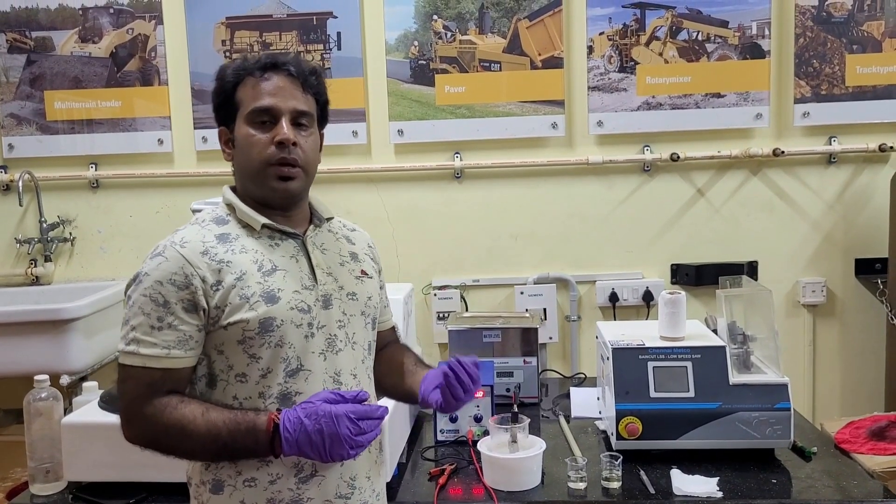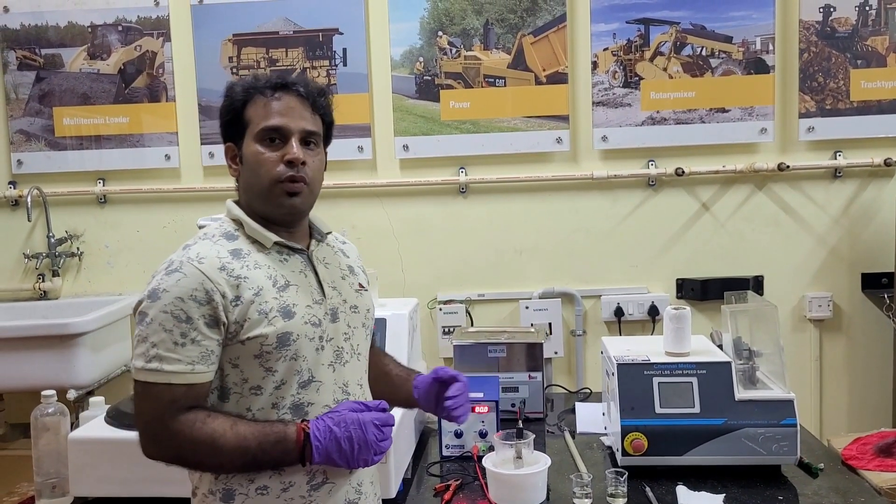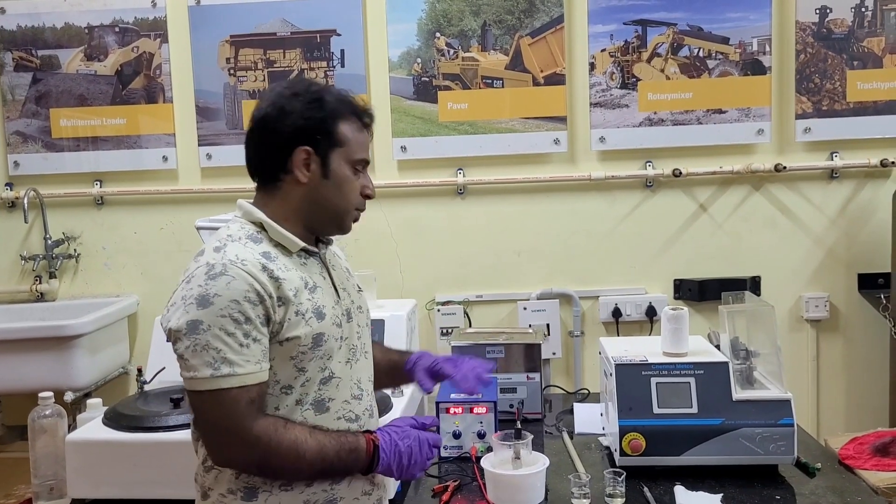Electropolishing is basically used to prepare the specimens for doing the EBSD. So, for doing the electropolishing, we are using some specific kind of setup.